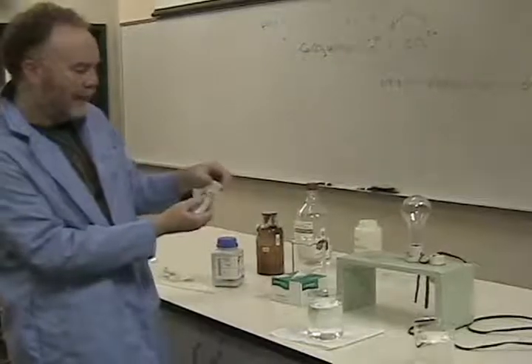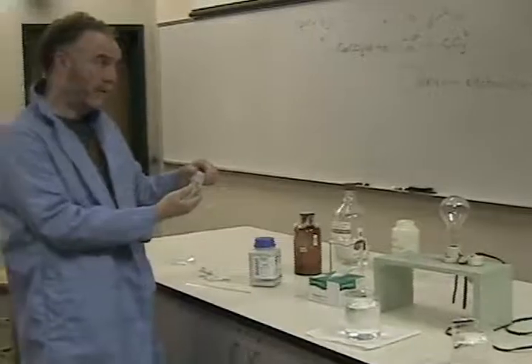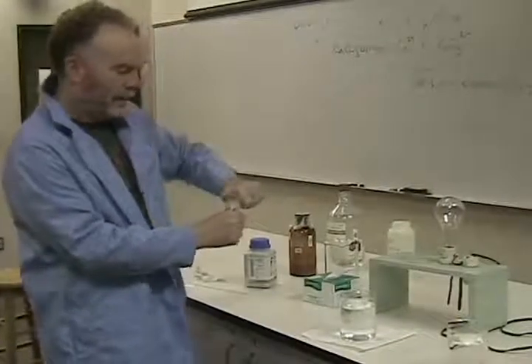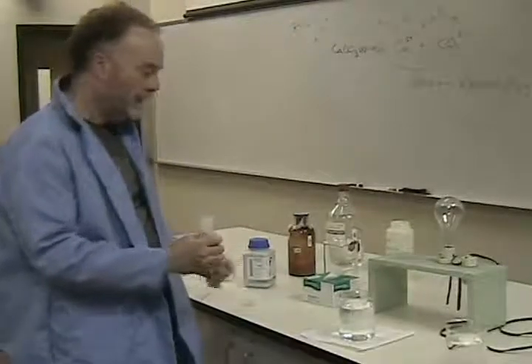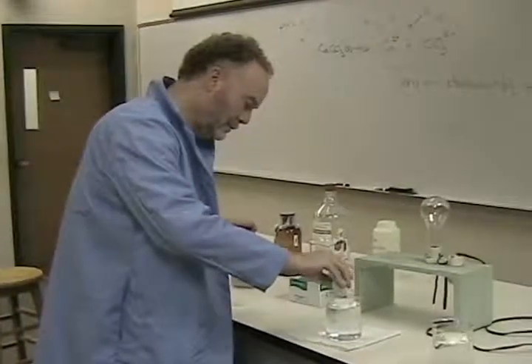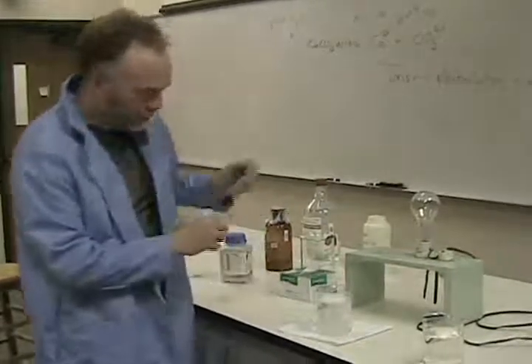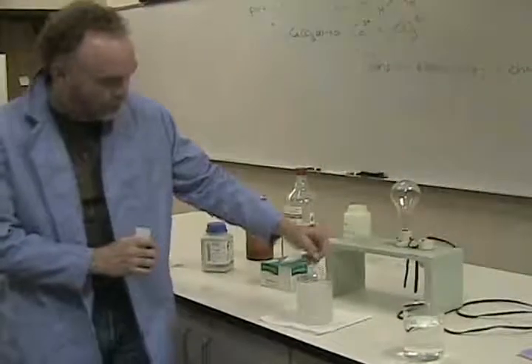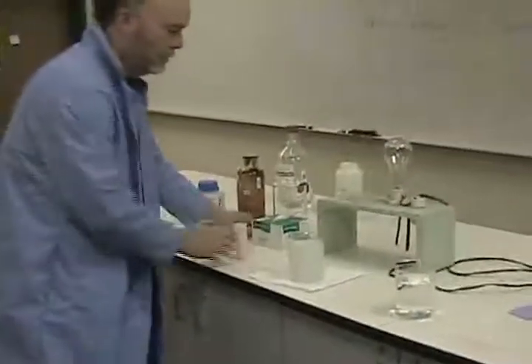This is one called calcium carbonate or limestone, as it's known generally, or sometimes in a crystalline form as something called calcite. And we know that limestone doesn't dissolve in water like sodium chloride does. So if we take a little bit of this, we'll see that it just sits on the surface here, maybe forms some cloudiness or turbidity in the solution.